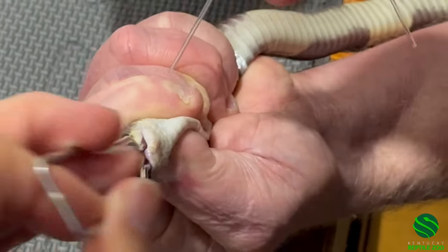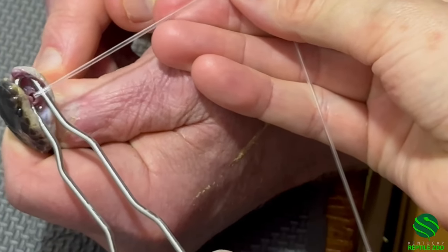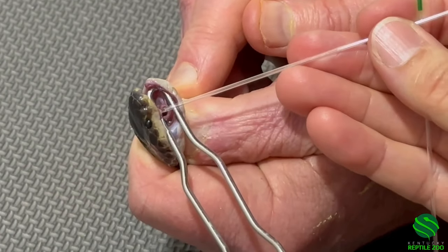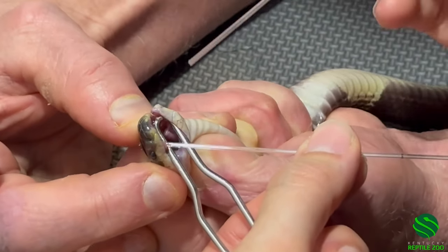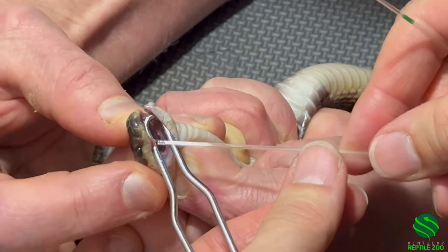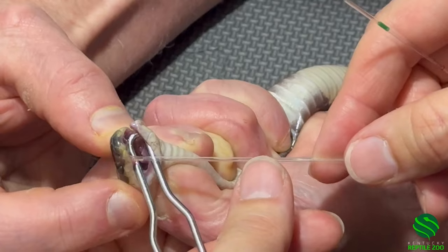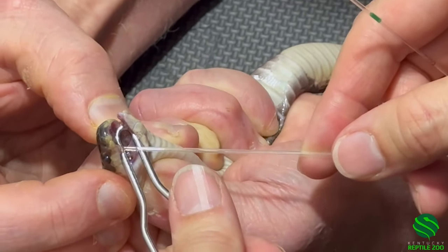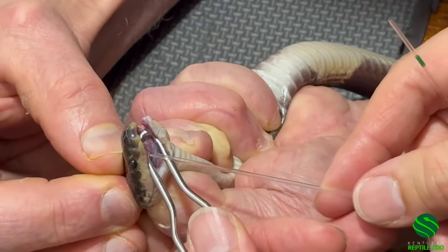You have to go in this direction. Is it on there? Can you see it? It looks like it is — on that one it is. I can try to get this one too. Just do one at a time. I don't know if it's in there. It is. Nope, no it's not. It's torquing so much. The speculum is way too big — that's the problem.